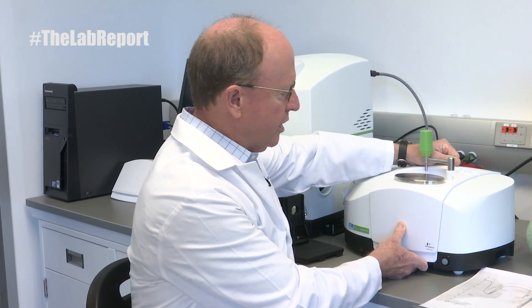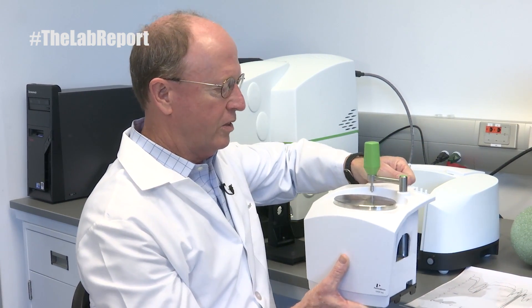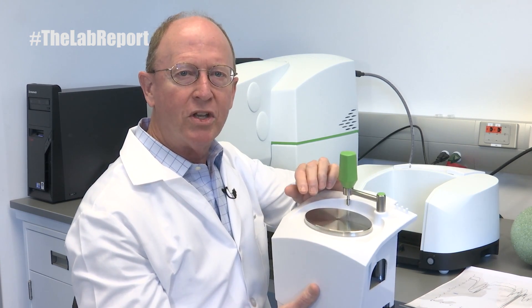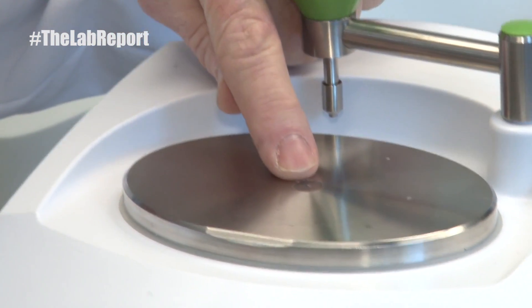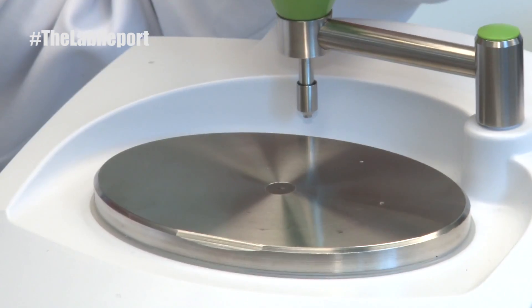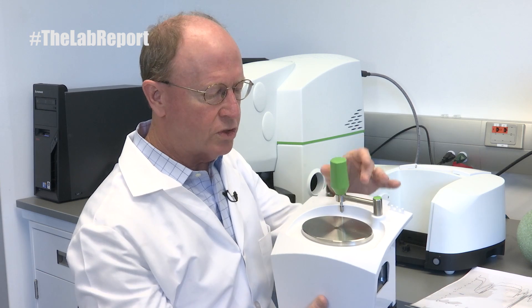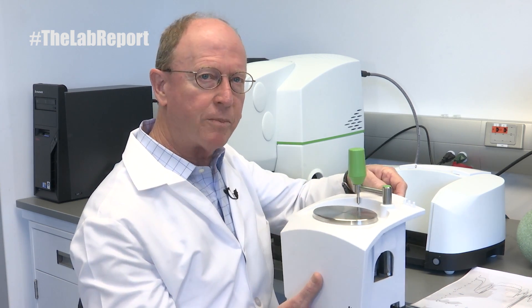The Universal ATR is an accessory, as you see here, that allows for the analysis of any liquid or solid sample. You simply place your sample right on a diamond crystal that's right in front of my finger. And if it's a solid, you can use this clamping mechanism to clamp and put pressure on the diamond crystal with your sample, or you can put a liquid directly on here with no sample prep.